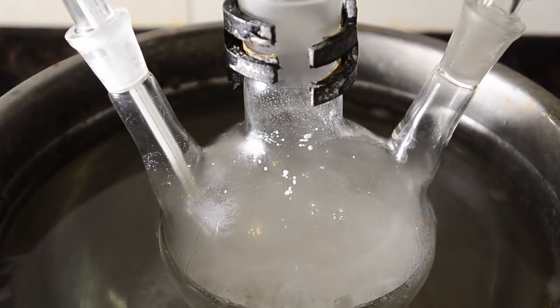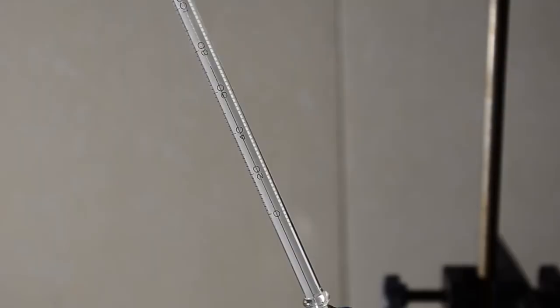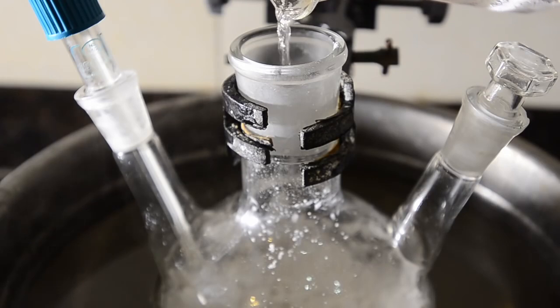It's easy to overshoot. We added a little too much and quickly hit 70 degrees. So go slow and allow the mixture to cool between additions.